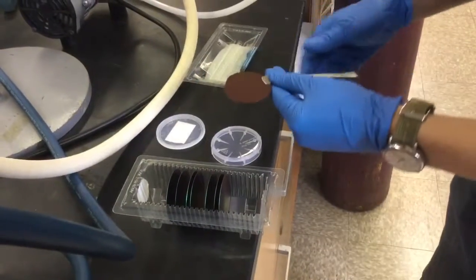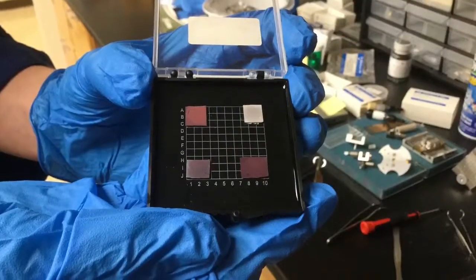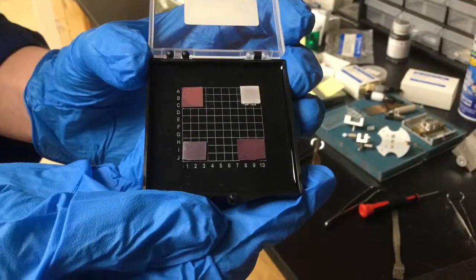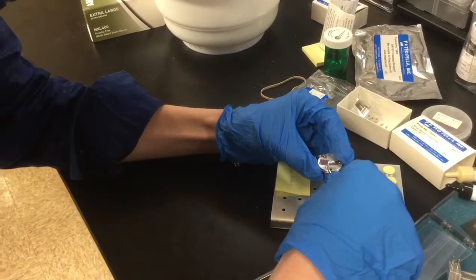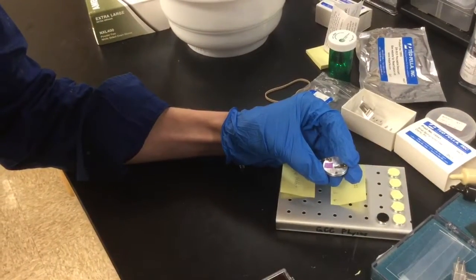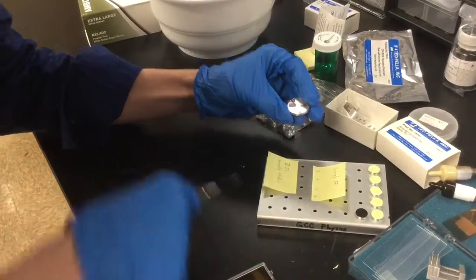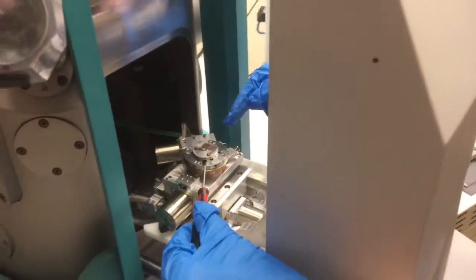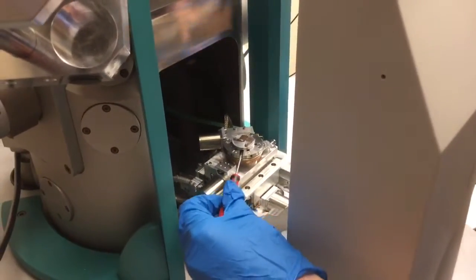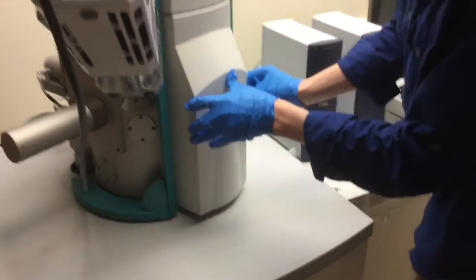The journey continues for the little silicon wafers today, as Zach cuts them up into samples for the Scanning Electron Microscope, or SEM. He will bombard his wafers with electrons, which the SEM can see and use to create an image. First, he loads a few samples onto a stand, screws them firmly into place, then sets them up in the SEM. When he's ready, he seals the chamber and begins pumping the air out, as a vacuum allows for a clearer picture.